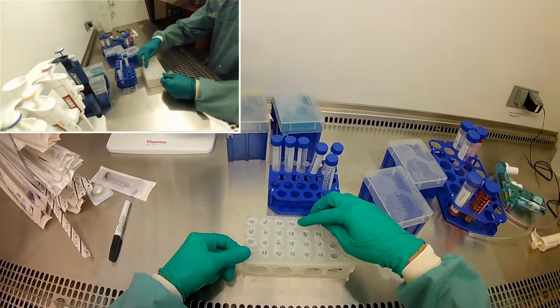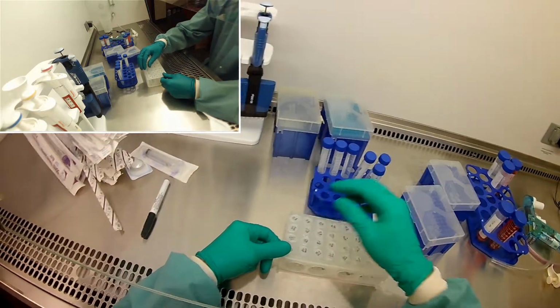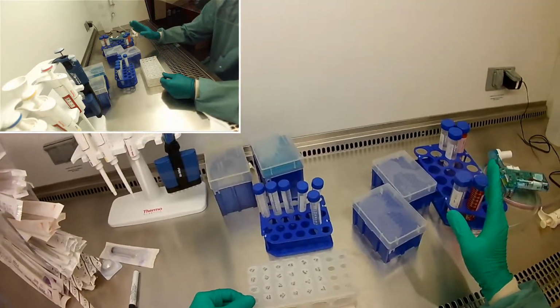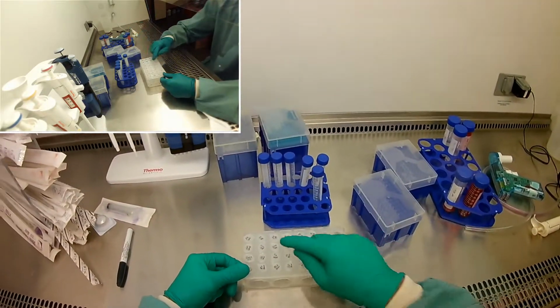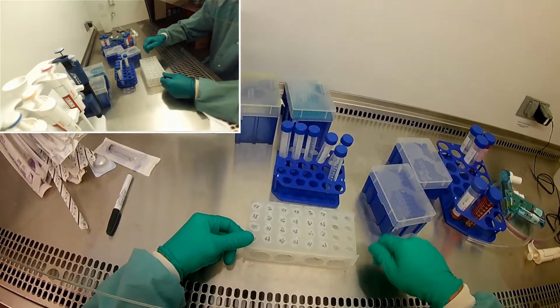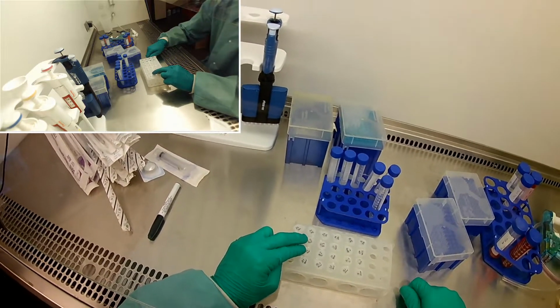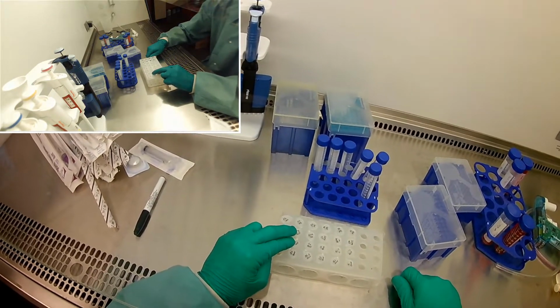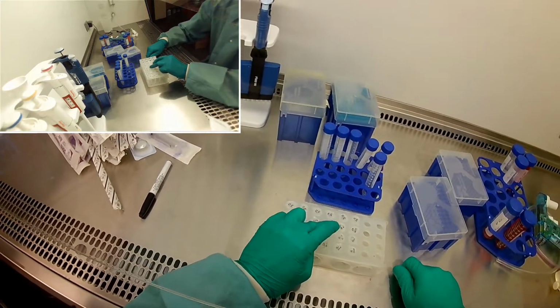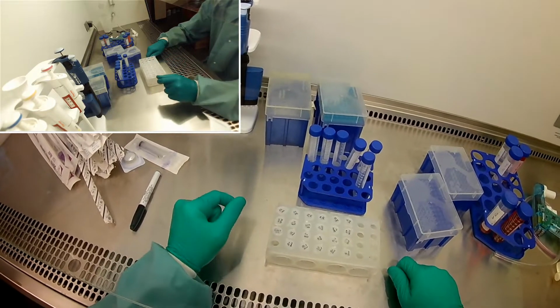Okay, and so then these are just serial dilutions to half the concentration. And then my 12% will just be some extra just for fun. I am going to ignore the 0.2%. So this will actually be like 12.2%, 8.2%, 4.2, 1.2%. For bleach and ethanol, I'm going to do the exact same thing for both of them. I'm going to do 8, 4, 2, 1, and 0.5%, volume to volume. Okay, so I'll just make the 8% first and then just serial dilute down.